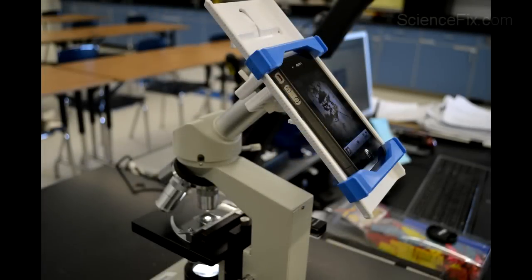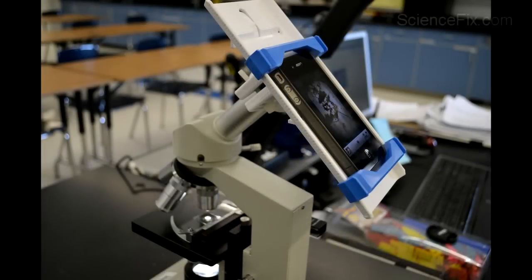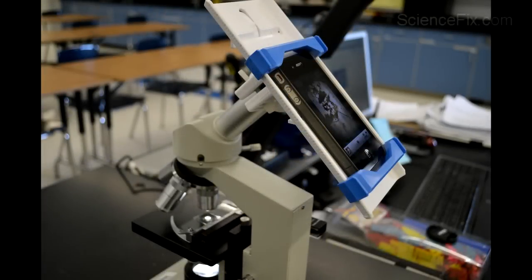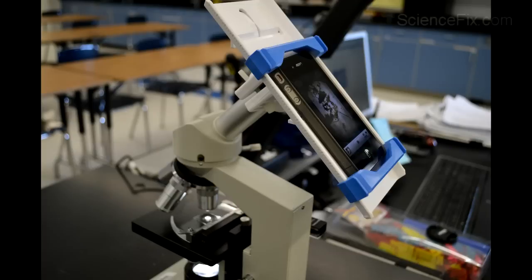Here we have a system where you can put your smartphone, attach it to the eyepiece, and so you can easily see it — it's like a monitor.